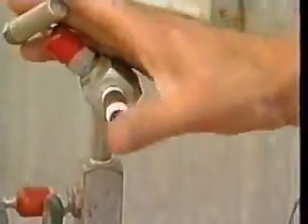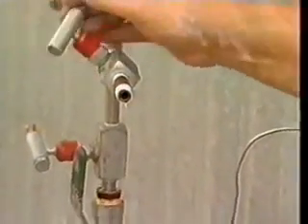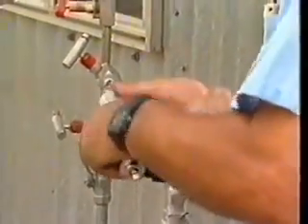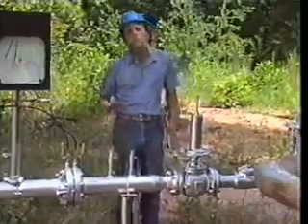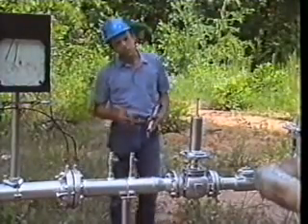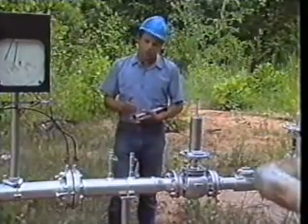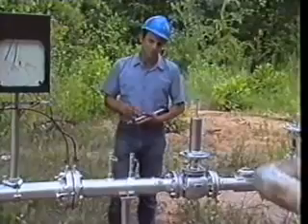Sample cylinders are usually connected to the flow lines in one of two ways. Some locations have a fitting permanently installed where the sample cylinder is directly connected. At other locations, the cylinder is connected to the flow line using a flexible tubing. Stainless steel tubing is preferred. However, a non-reactive metal tubing like copper or steel may also be used.